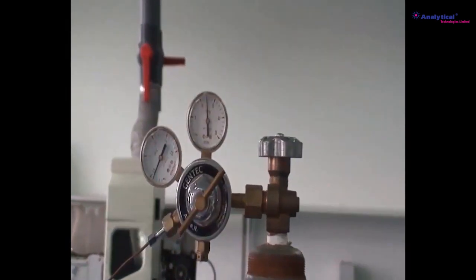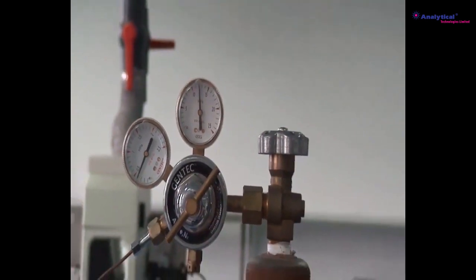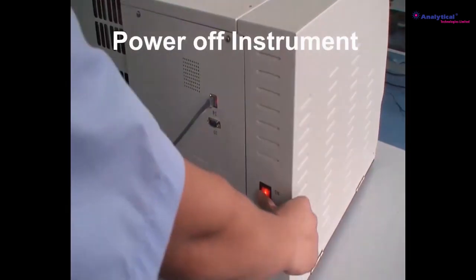Close the main valve of the gas cylinder. Switch off MS. Switch off GC.